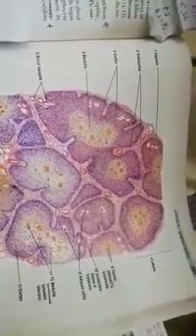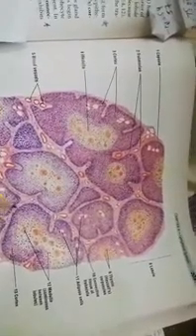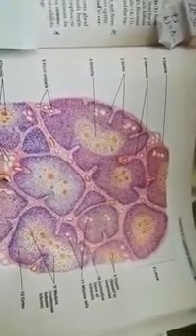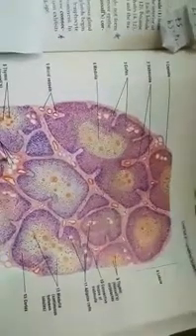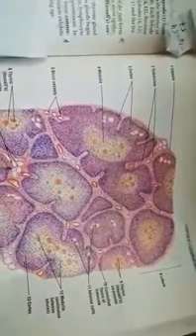Now, how are we going to explain it? You can see the septa or trabecula is having a neurovascular bundle in it, the artery, the vein, capillaries, and with increasing old age it is well laden with adipose tissue as well.